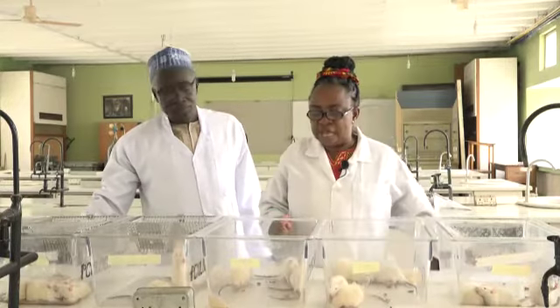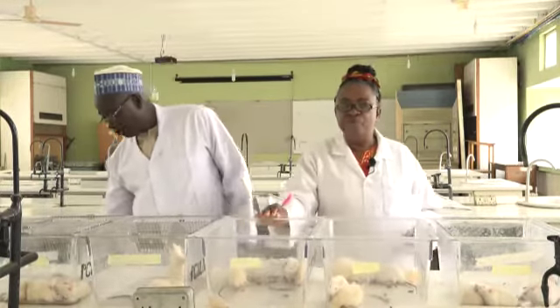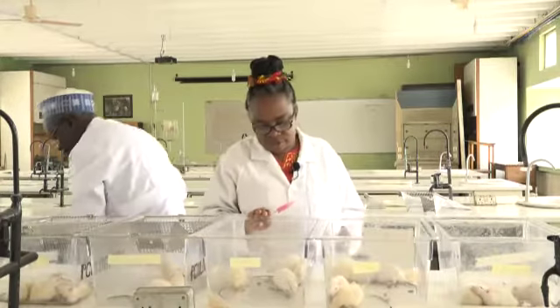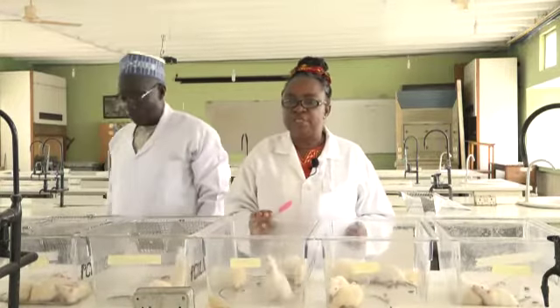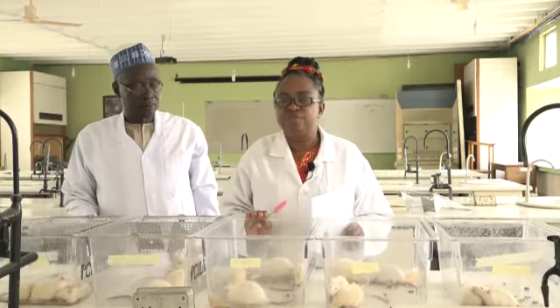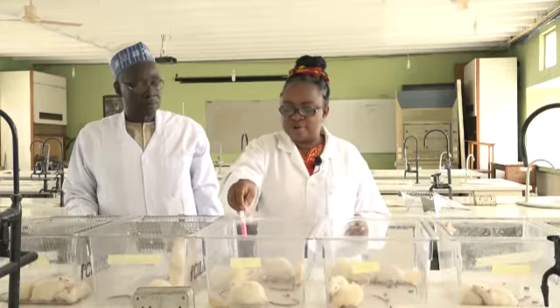Please write down the time that animals in group 3 have been poisoned. We expect to see the worst degree of toxicity in this cage because these animals will not receive treatment at all. Watch this rat.